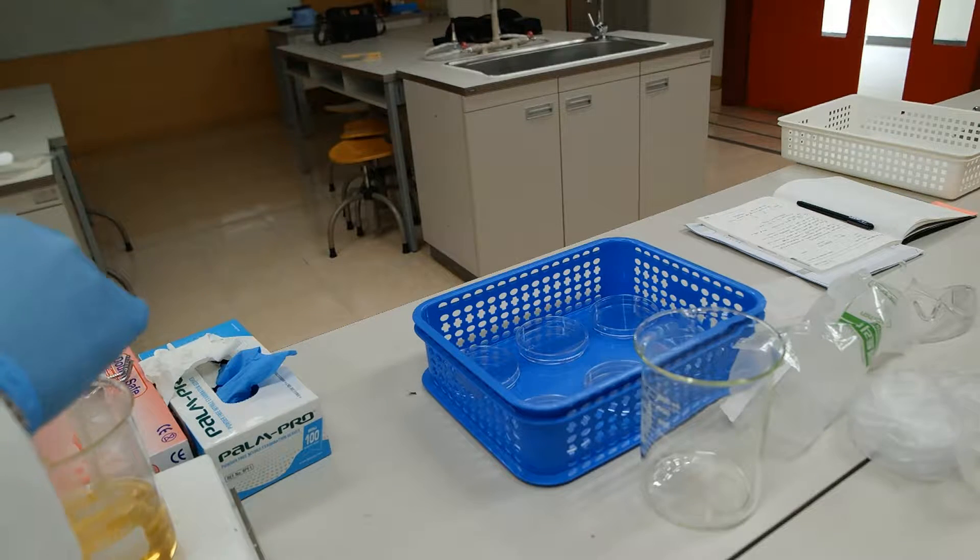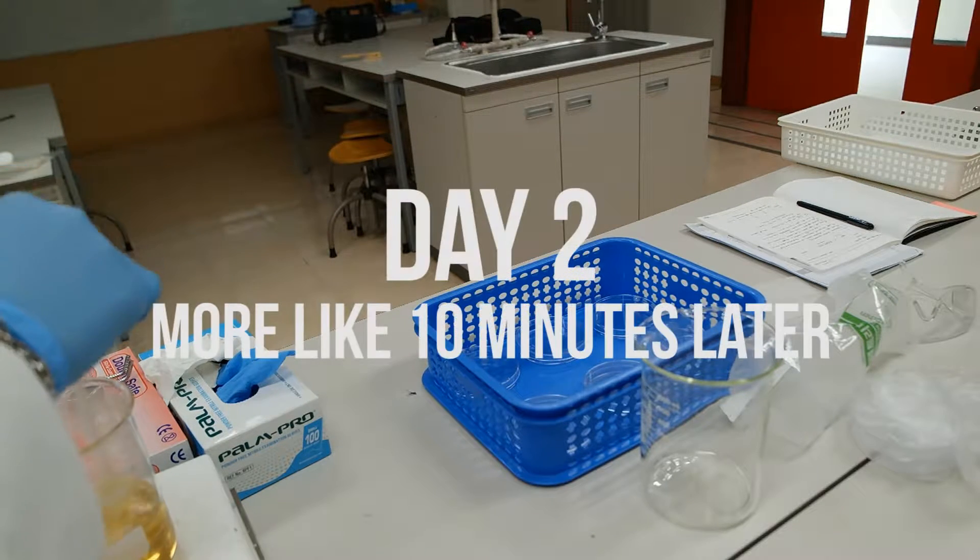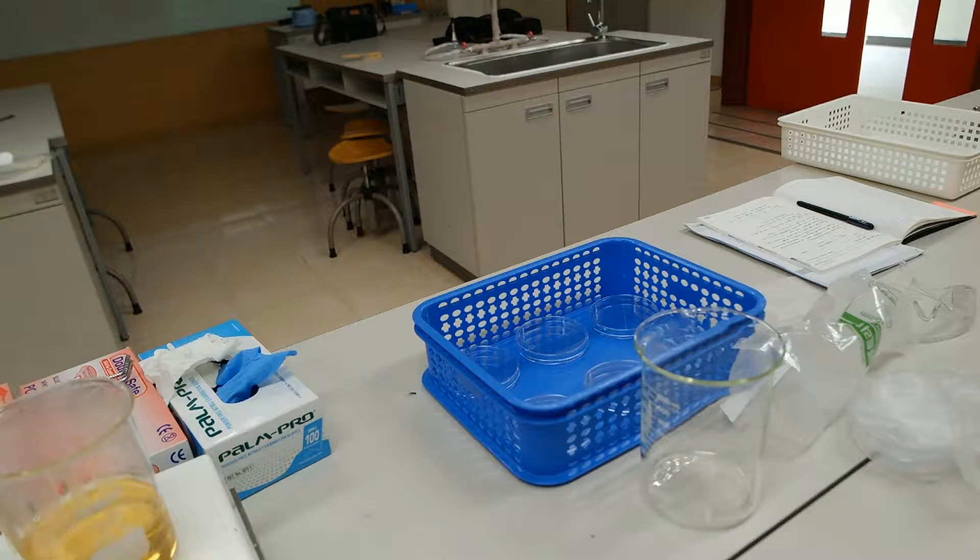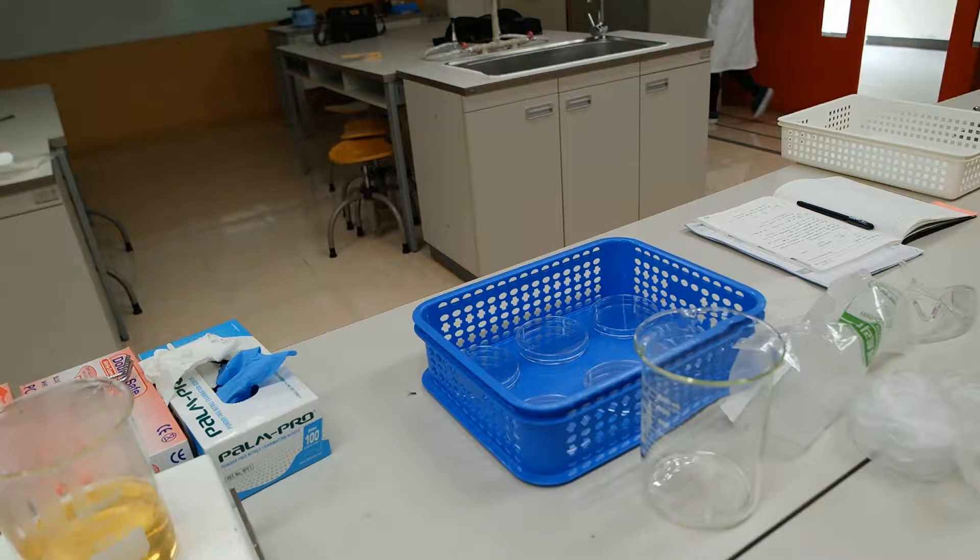Wow, it smells so bad. It smells so bad.